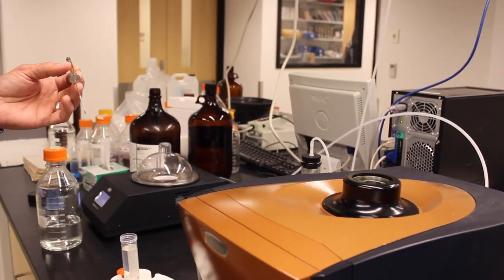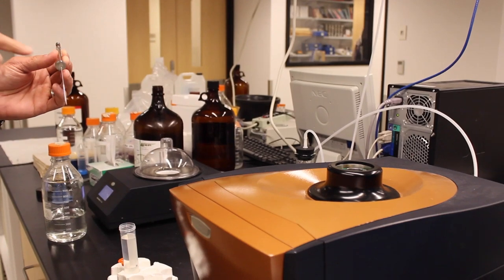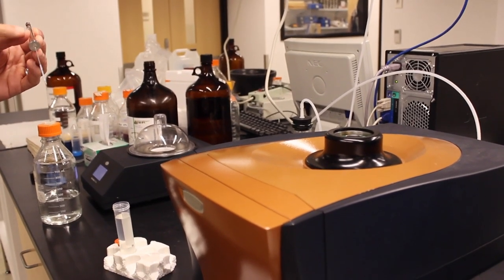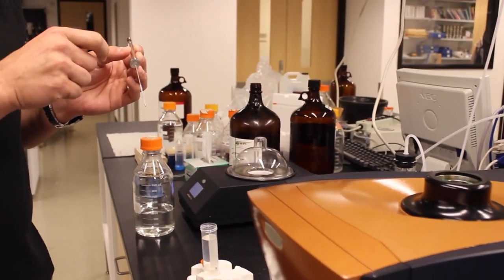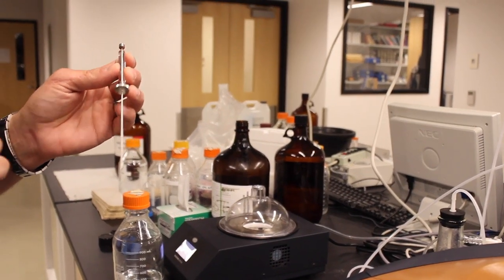and the syringe to be whatever material you're titrating in to the cell from the syringe. This needs to be flushed and filled with exactly the same buffer as the cell has been flushed and filled with.